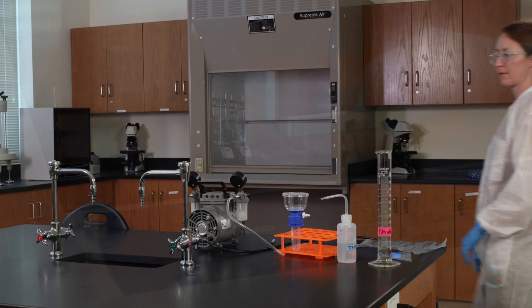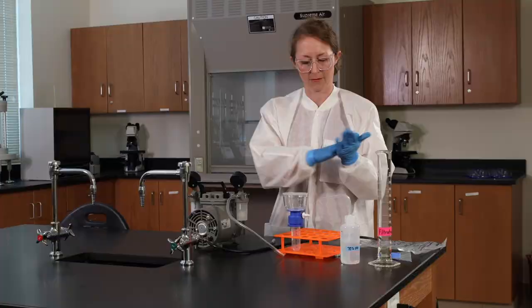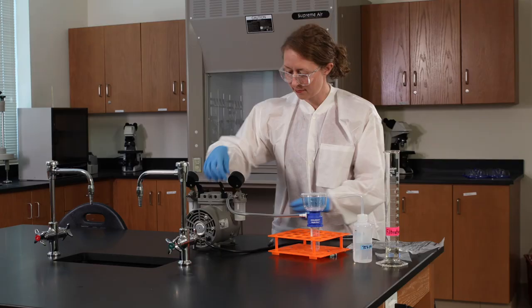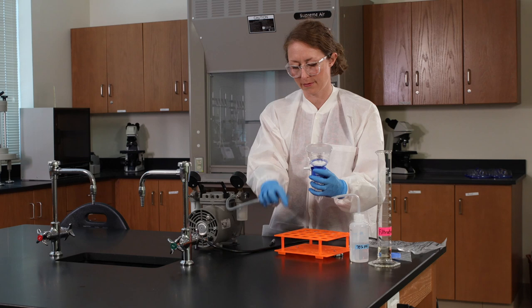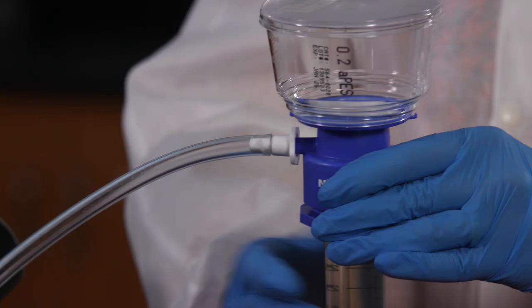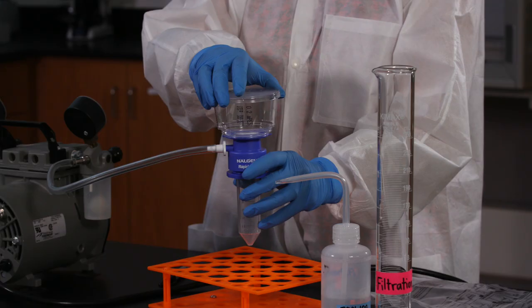Back at the workbench, we need to filter our last sample of broth. Disinfect your gloves with alcohol. Set up the filtration unit and disinfect your gloves again. Attach the tubing. Double check that your connections are tight.